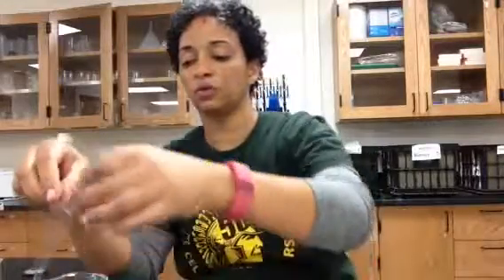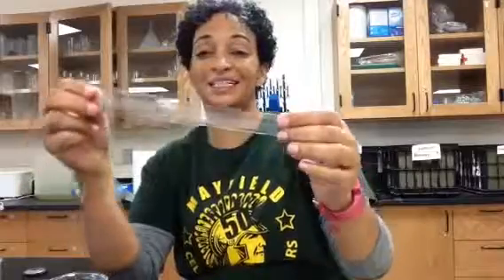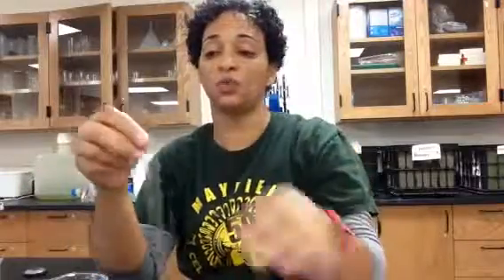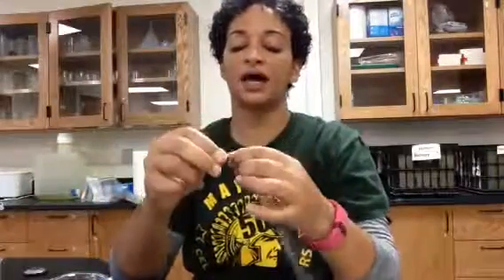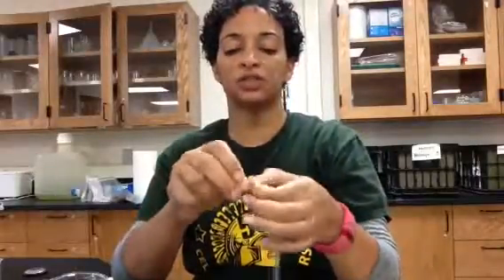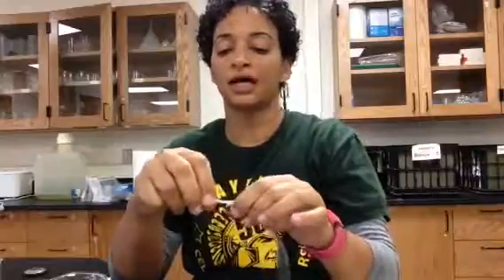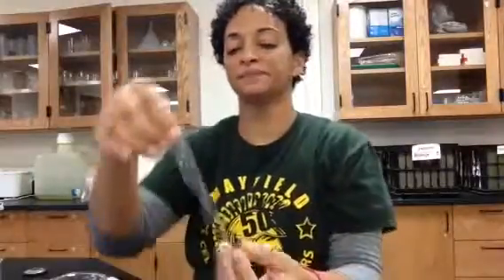I'm going to get my dialysis tubing — it has to be wet in order for it to work. First, I need to tie a knot in one side. I'm going to tie what I like to call a balloon knot so that when I pour liquid into it, the liquid doesn't pour right out the other side. I tie a nice tight knot — I don't want any leaking.